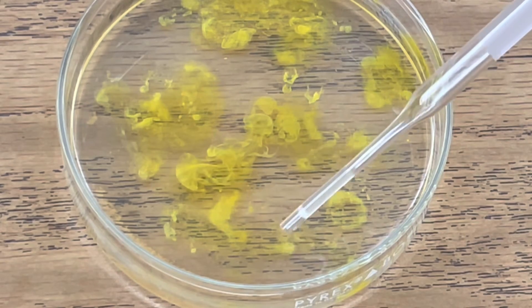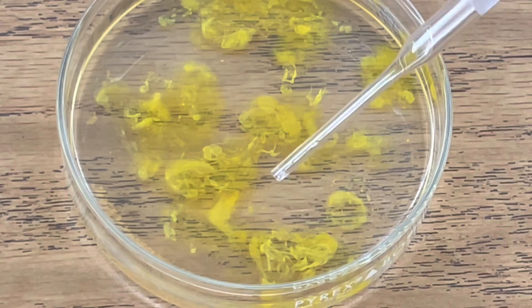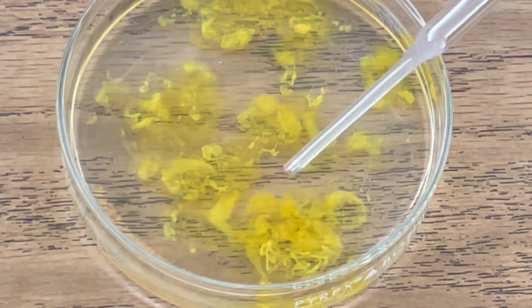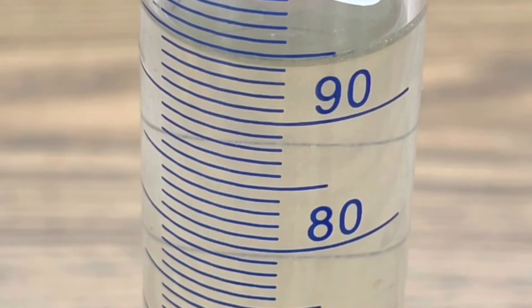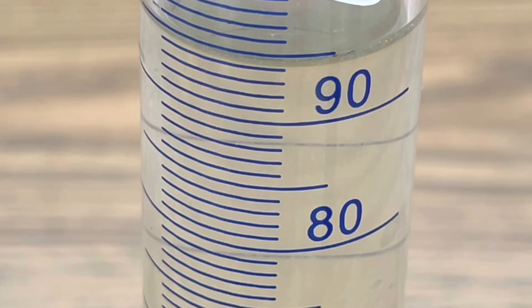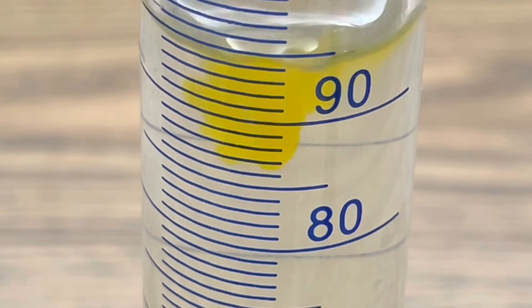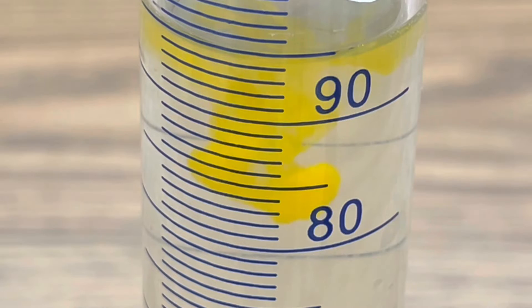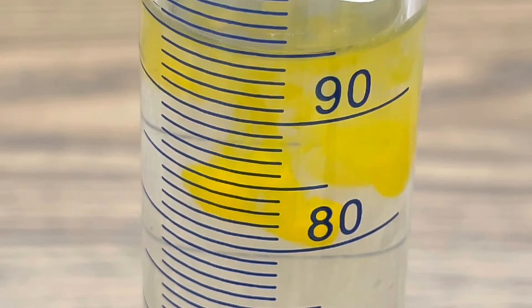Look at that. That is so beautiful. Here's another look at that precipitation reaction in the graduated cylinder. Just awesome.